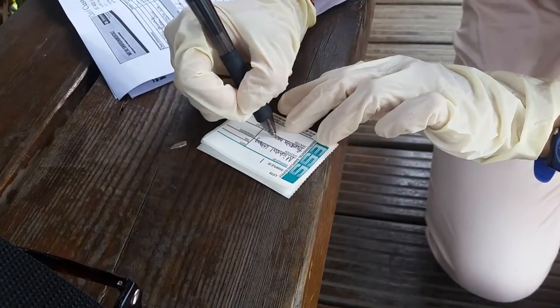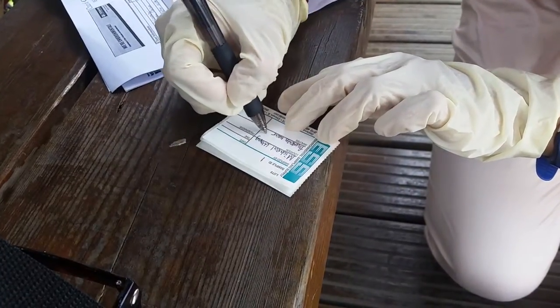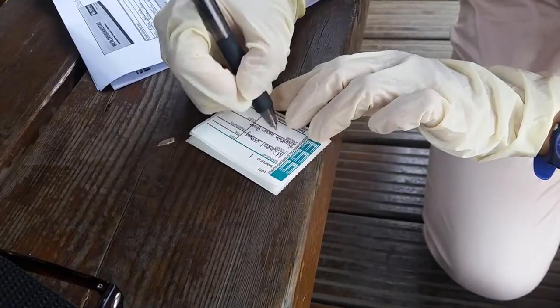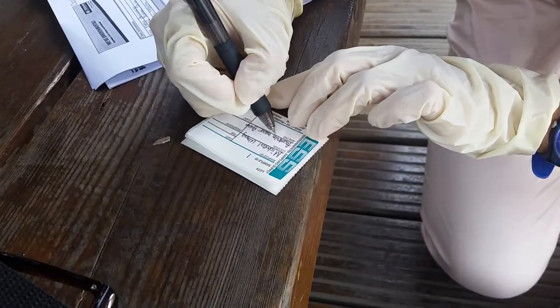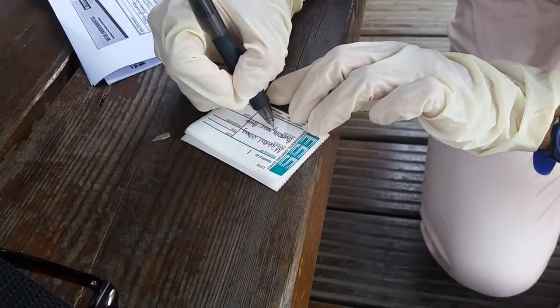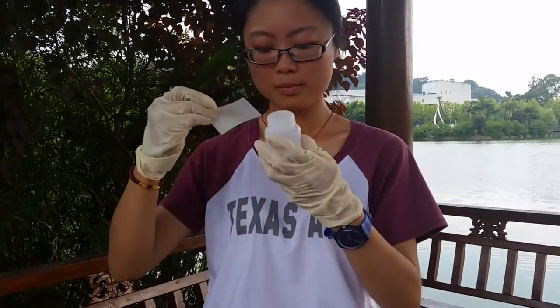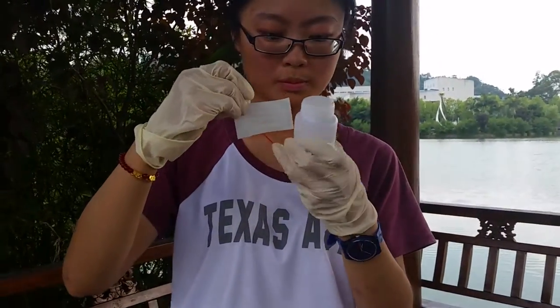Once the background sample has been taken, make sure to label the container with the sampling individual, location, date, and time to prevent misidentification of samples.